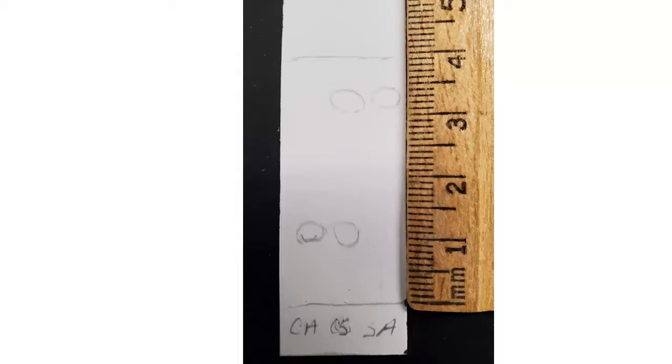For your caffeine and salicylic acid mixture, you would give 2 RF values for that. So you'd give the RF value for caffeine, which is the same as what we just talked about, that spot's in the same place, as well as the RF value for salicylic acid. So I'd want 2 values for that when you're looking at that middle spot with 2 compounds.